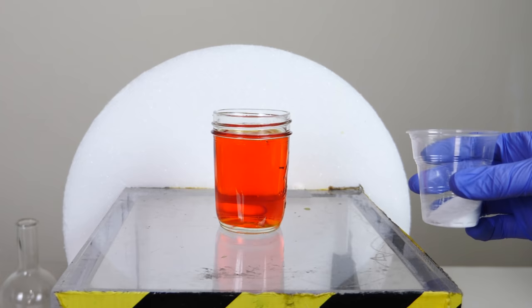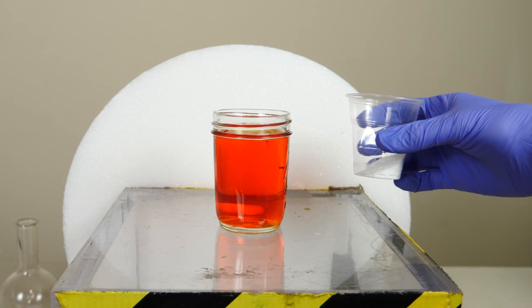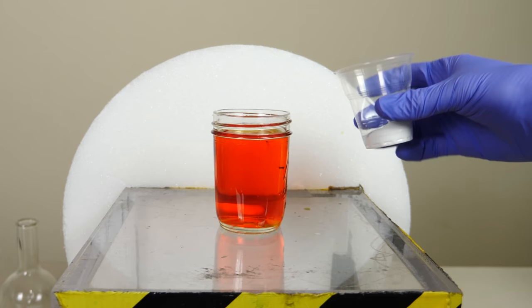So let's see if we can win the battle a little bit easier in these two competing reactions. It's glucose versus oxygen. Let's add some more glucose.